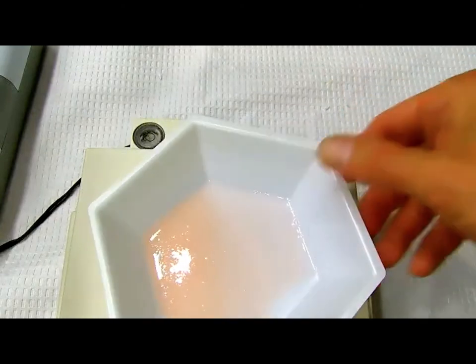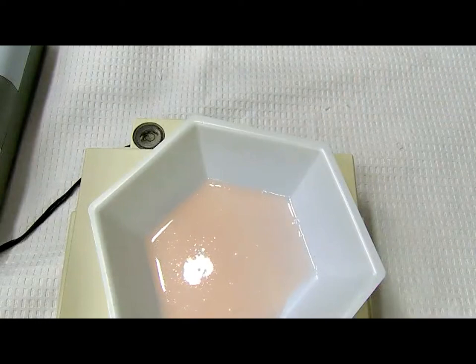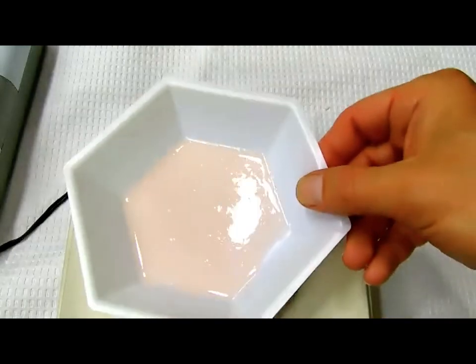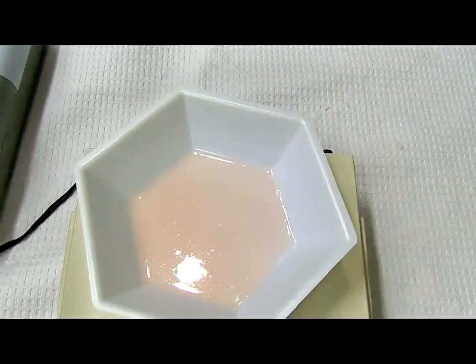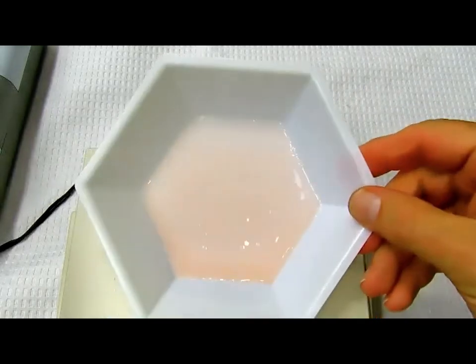Why is it no longer clear? We started with two clear liquids. The cherry syrup is not colorless, but it's clear, and the mineral oil was clear. Why is it cloudy? Because you have the mineral oil in the form of really small droplets. You can't really see the droplets of the oil separate, though maybe you can see some air bubbles, but that's what's making it cloudy, okay? So we said it's a light pink or a pink, odorless, opaque emulsion with no visible droplets. We're looking here, I don't see any visible droplets.